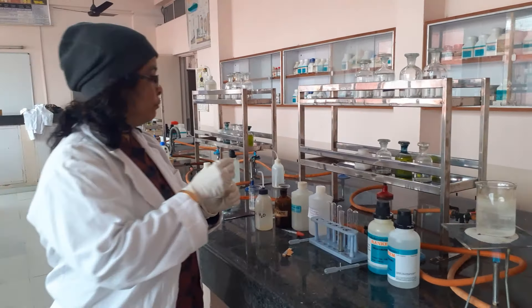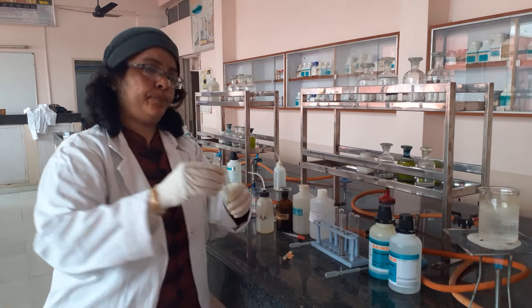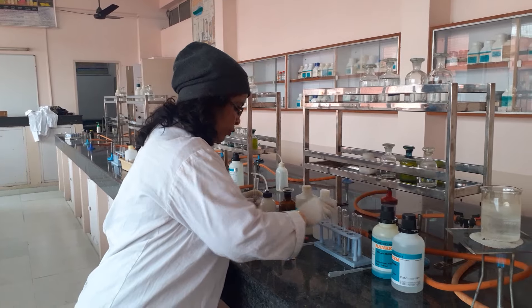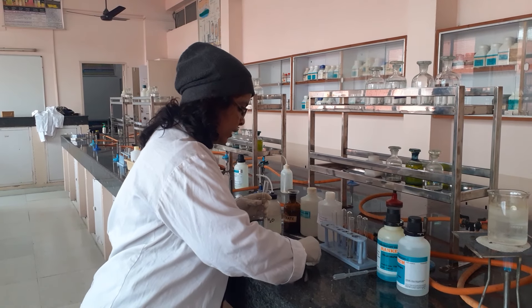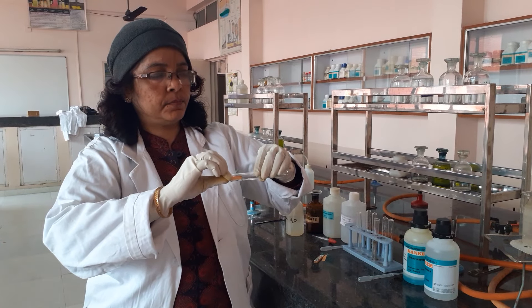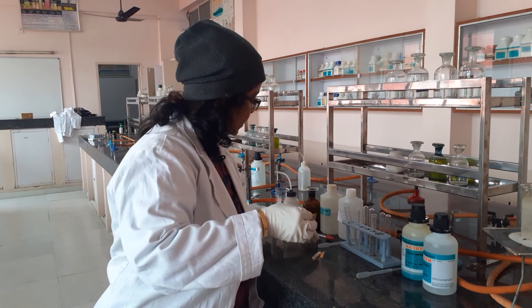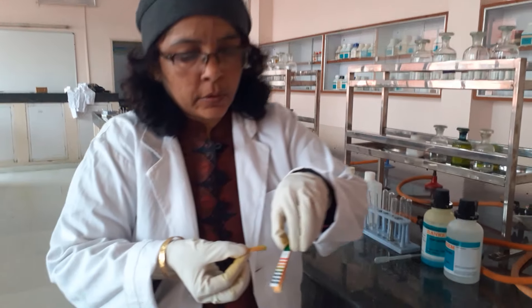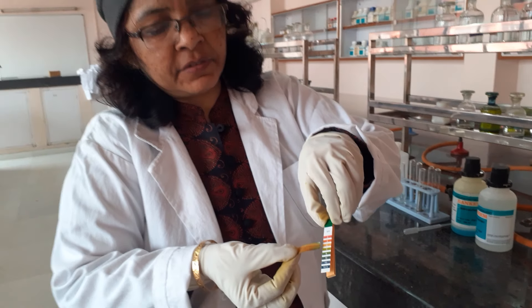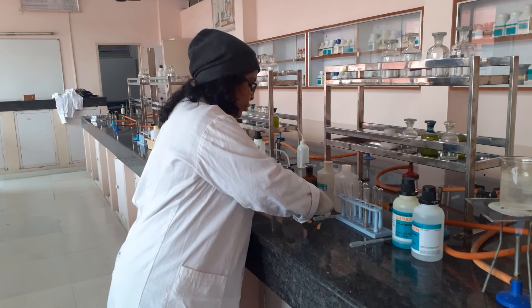Since there is no change from odor, we move to the third observation — identifying the acidity or basicity, i.e., the response to pH paper. I will take my pH paper, which is peach in color, and put it into the solution to see the change. As you can see, it is going from yellow towards greener, which means it is around 7. So the pH is approximately 7, showing that the aldehyde sample given is a neutral sample.